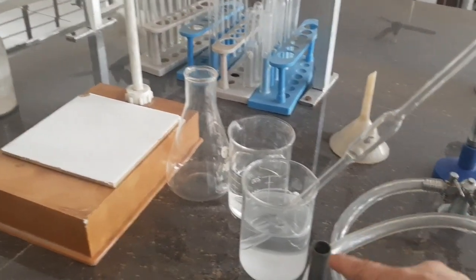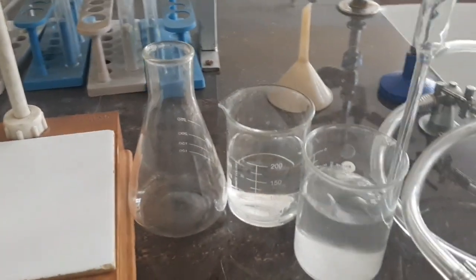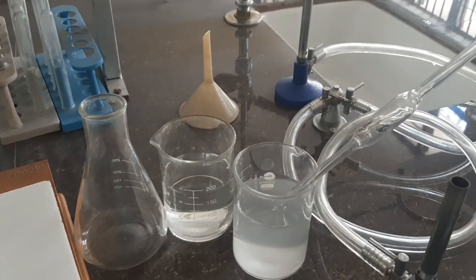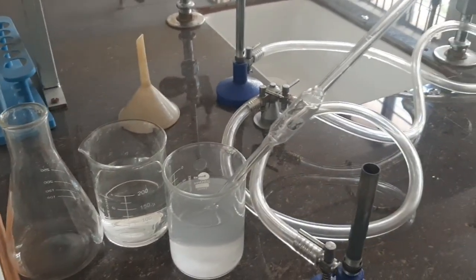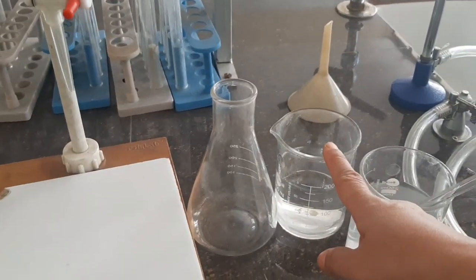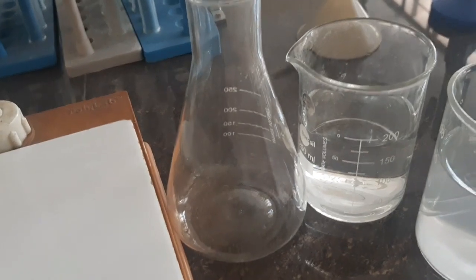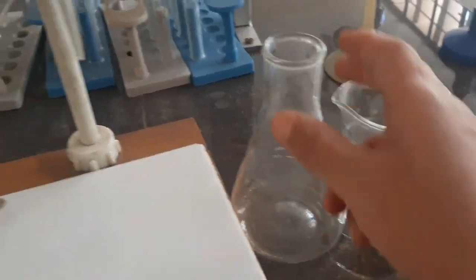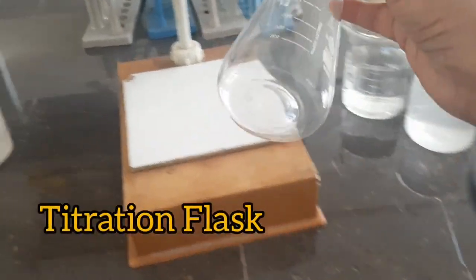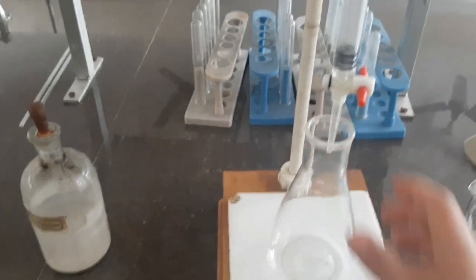I'll be sucking in 10 ml of sodium hydroxide solution using the pipette. This is the standard HCl solution — a solution whose concentration we know — this is 0.1 molar. This is a conical flask, also called a titration flask. We are going to do the titration using this.